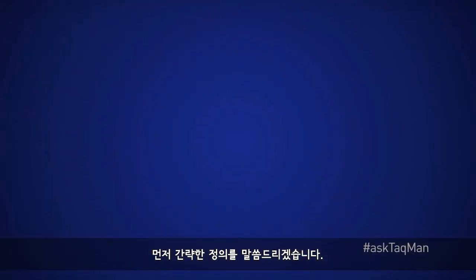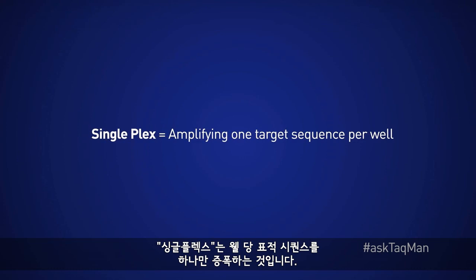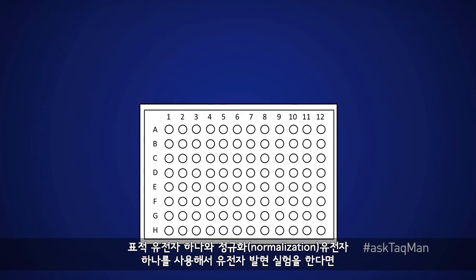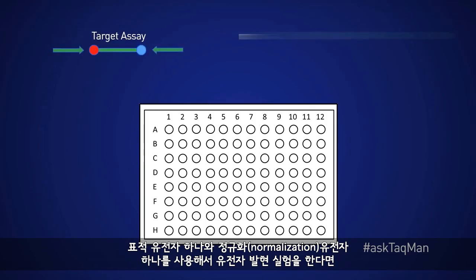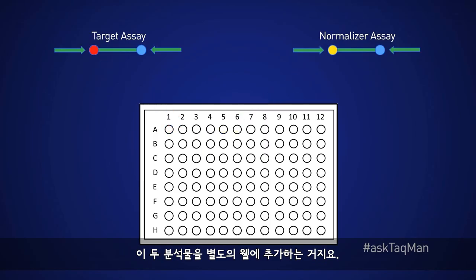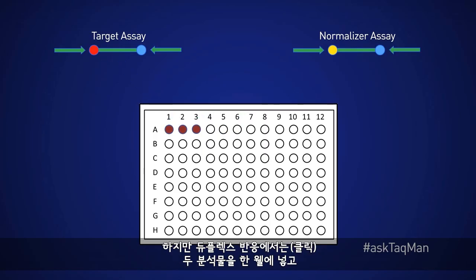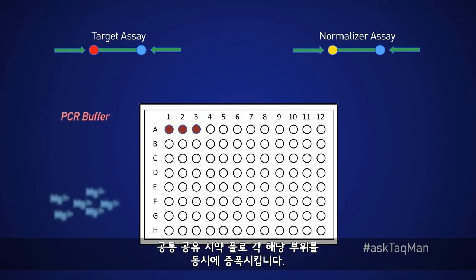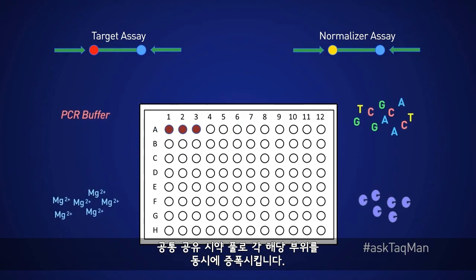I'll start with a quick word on definitions. Singleplex refers to amplifying just one target sequence per well. So for someone doing a gene expression experiment using one target gene and one normalizer gene, these two assays are added to separate wells. But in duplex reactions, both assays are added to the same well and thus amplify their respective sites simultaneously while drawing on a common pool of shared reagents.